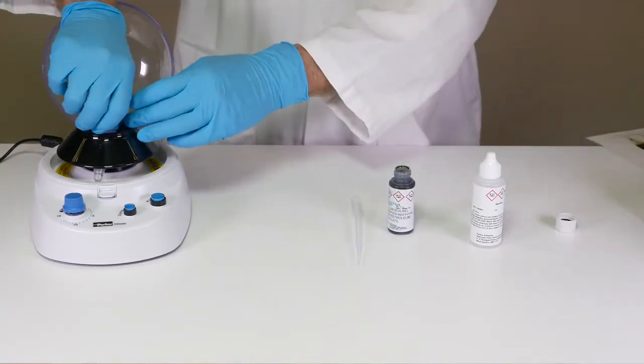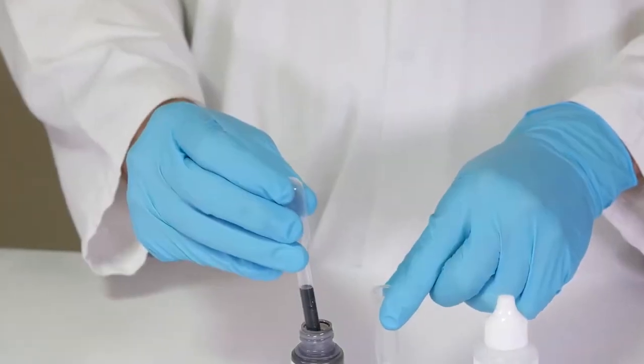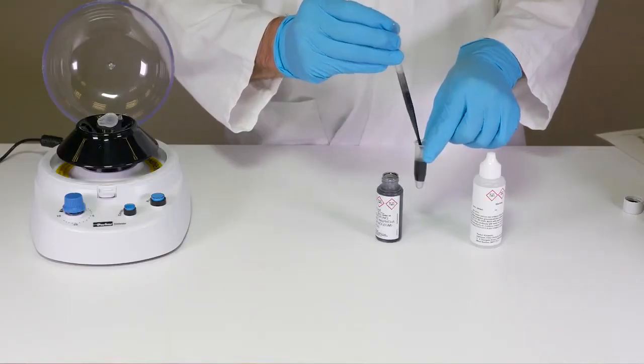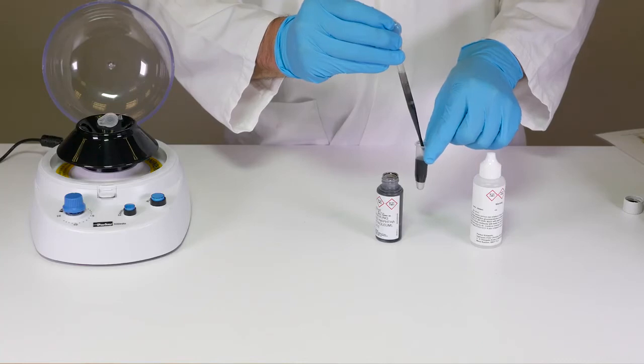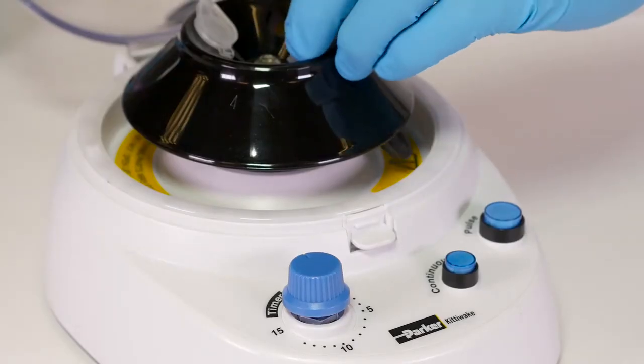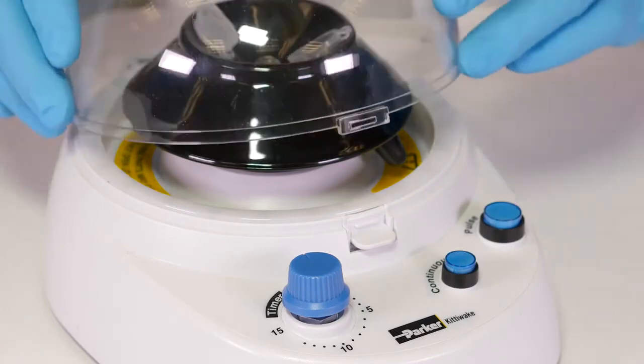Using the supplied pipette, extract the mixture and add to the test tube containing reagent alpha. Fill the tube to the five milliliter graduation line. Ensure the lid is firmly sealed and return the tube to its position opposite the water-filled test tube.